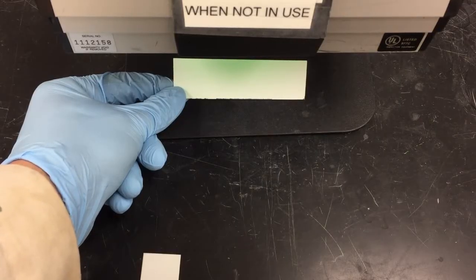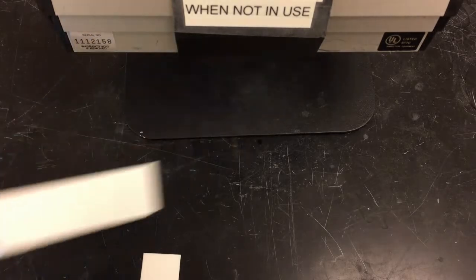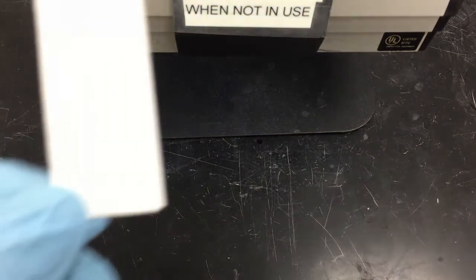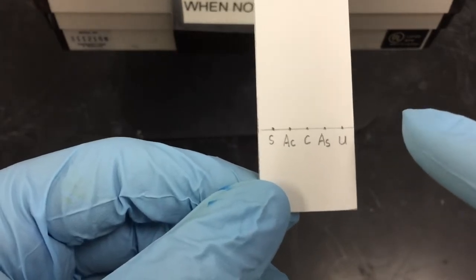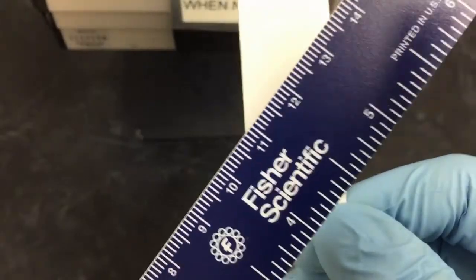Before you use a plate, please check it under the UV light to see if there is any contamination. If the plate is already contaminated, don't use it. Draw a straight line with a ruler. Again, please make sure you do it with the ruler.